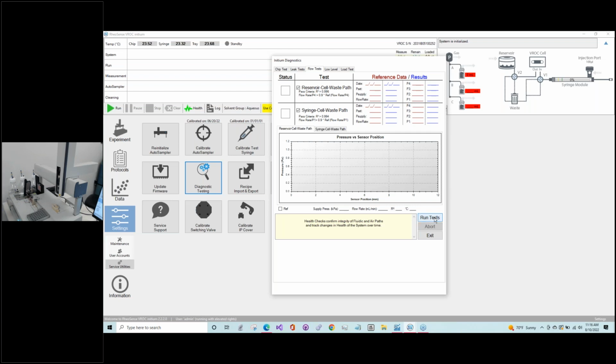Another thing is, if you have multiple chips and you do swap them out, this will also help you detect if all of the fittings are tightened. Hopefully you can see this because we don't have the camera view right now. But in the chip, if you replace it, you have to tighten these fittings on the inlet and outlet tubing. And sometimes if they don't seat properly or they're not tightened fully, then we can have failure on the flow test as well.